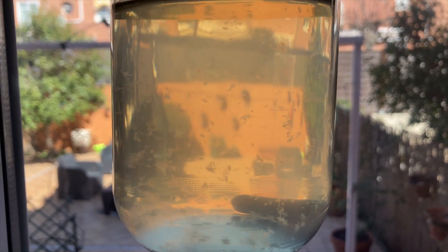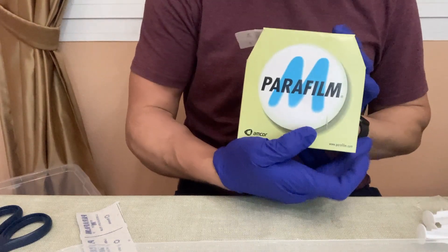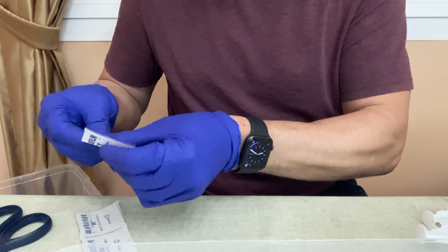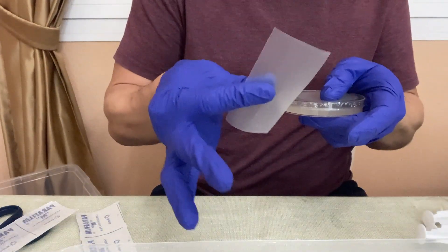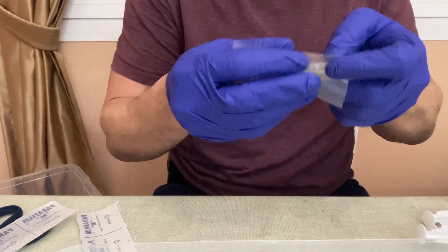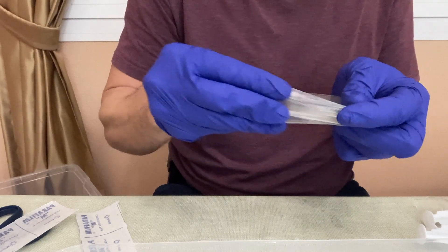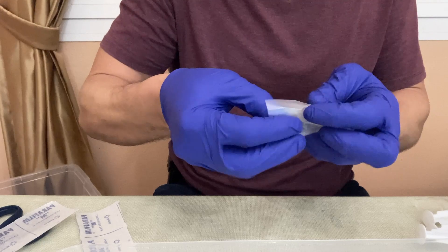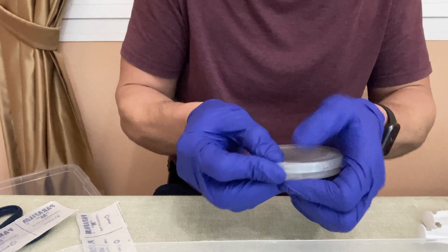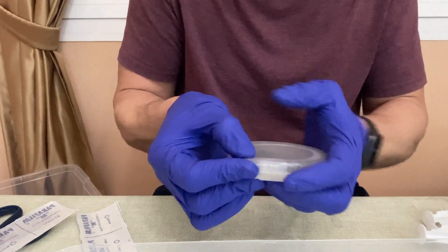This is a golden oyster liquid mycelium after just 24 hours. One more thing I want to show you — this is Parafilm, and it's worth your investment. It's going to act as a filter for your plates. I'll show you real quick how to put it on. Cut one strip along the lines on the film. Start with most of the Parafilm on the bottom, give it just a little overlap on top, hold it in place, and then pull and stretch all the way around. When I first did this I was using two pieces and still breaking them — but once you get the hang of it, you'll have a plate with a filter that allows for air exchange.